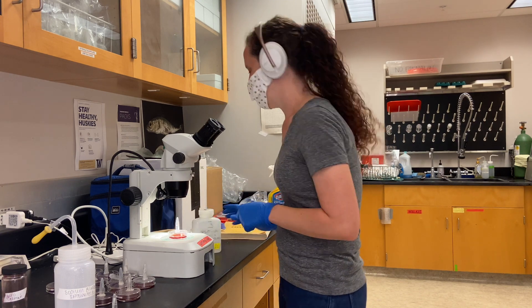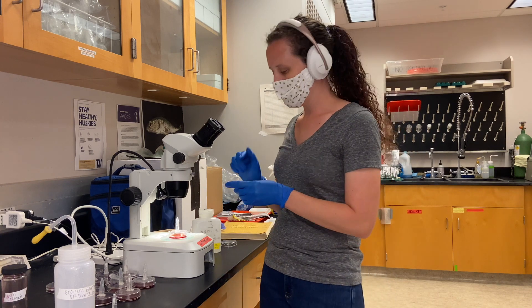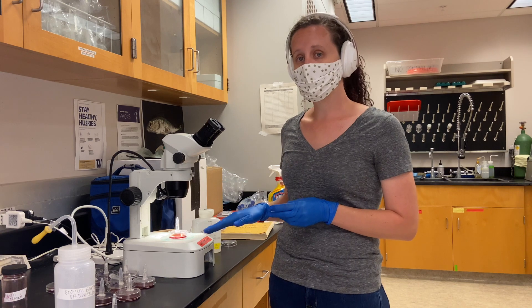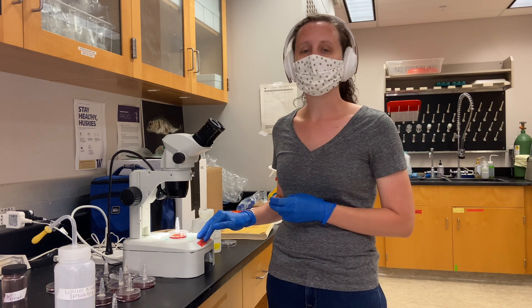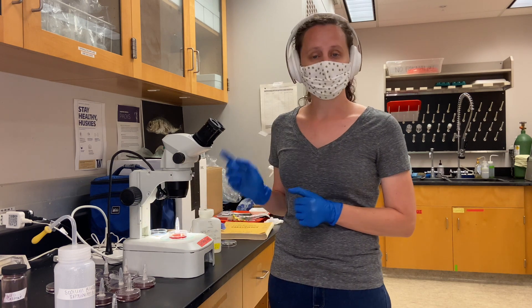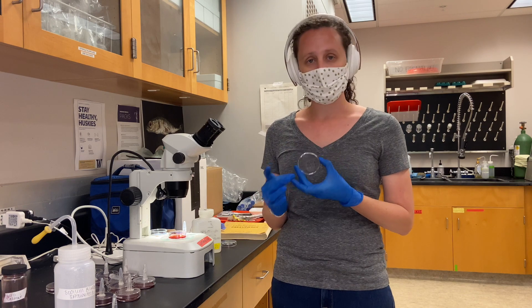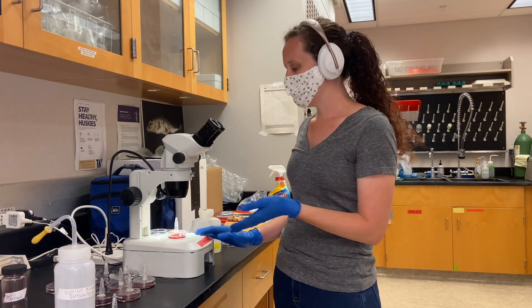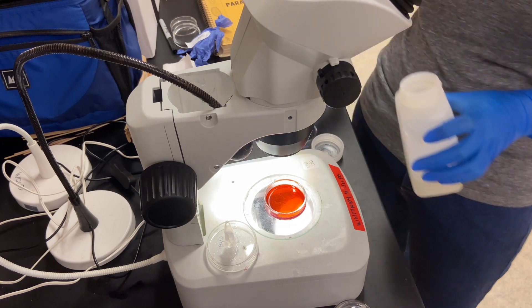I take my acid alcohol and get a new petri dish bottom. I think it's easier to put the acid alcohol in a new petri dish and then transfer the specimen over. You can also remove the stain from your current petri dish and add acid alcohol to it. The stain can be reused as long as it's not too dirty. It's very important to make sure that you get all the specimens whenever you're transferring them over. I write on the top of my petri dish how many specimens I have so I know I get all of them and don't leave anything behind — if you leave some behind, you're missing specimens for your analysis and they can pop up later in the stain where they shouldn't.